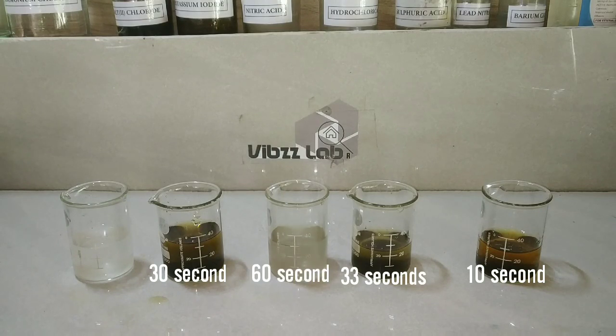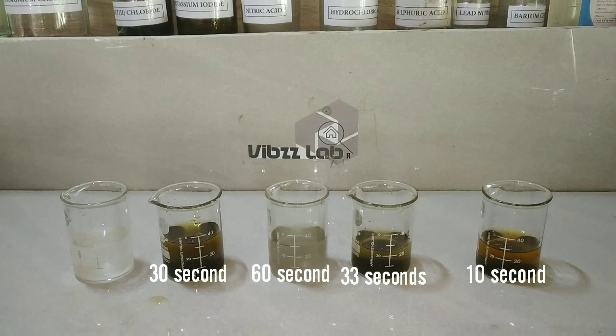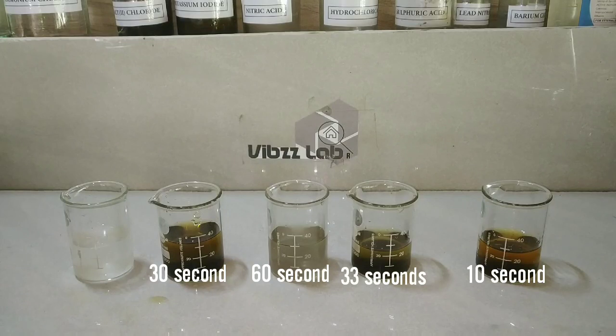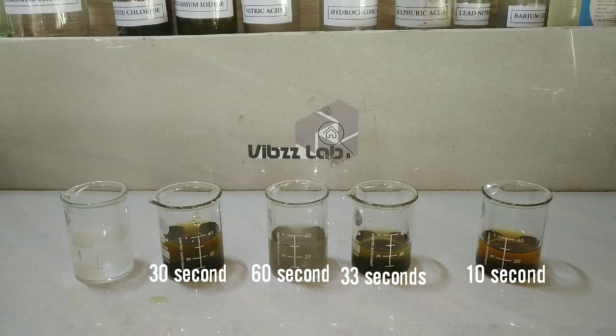Note that the third beaker has also changed color, and it took about 1 minute to change color.